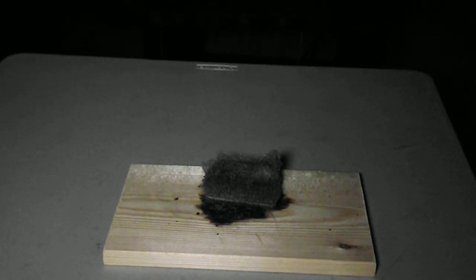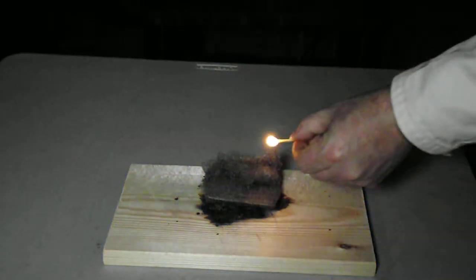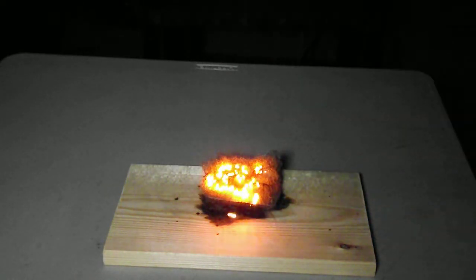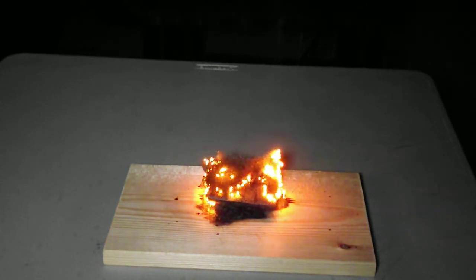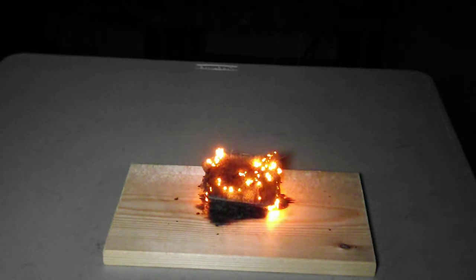What we have here is the ability to look at and actually observe how exothermic that reaction truly is. I can actually light steel wool and you can see it glowing. Now, surface area is one thing, concentration is another.